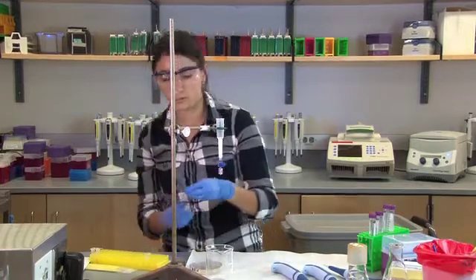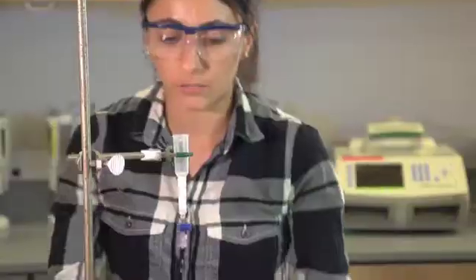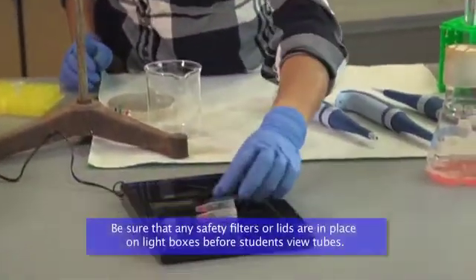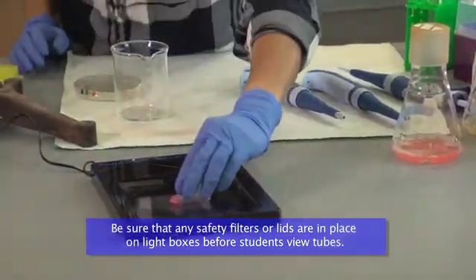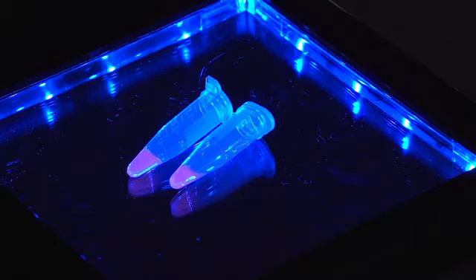And now we're going to put these on our blue LED light. And we can see that the tubes are pretty pink. But once we turn the light on, we can see how bright they glow. Again, another wow factor.